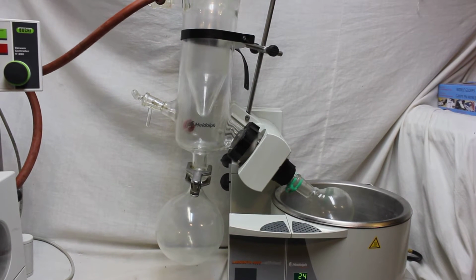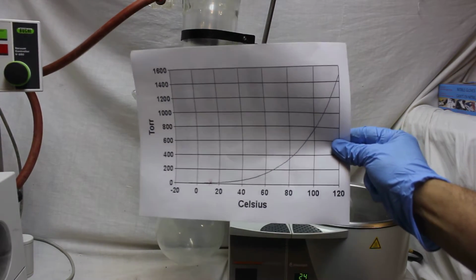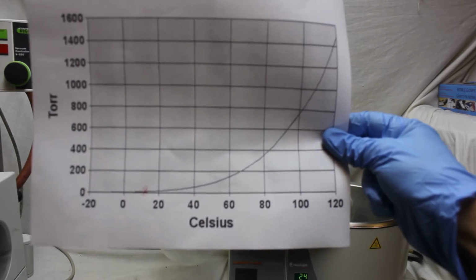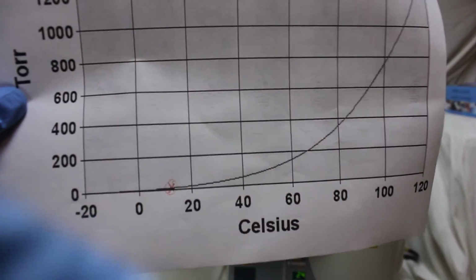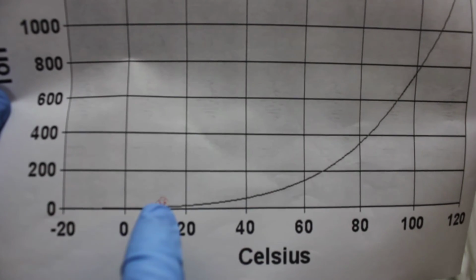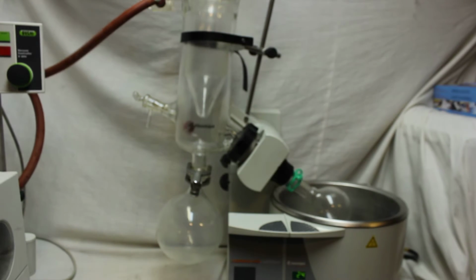and we can just perfectly evaporate water at this vacuum condition, even at room temperature, at this value and at this gauge. So you see, let me zoom in. You see here, so basically if you have almost 20 millibar, you can evaporate water at room temperature.